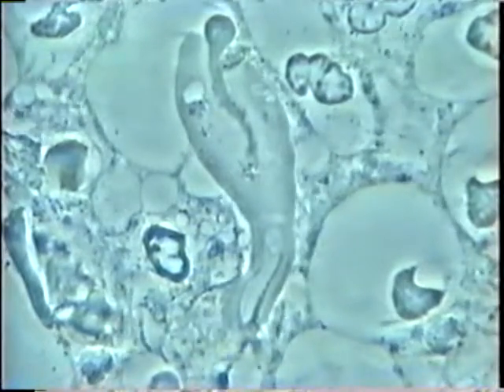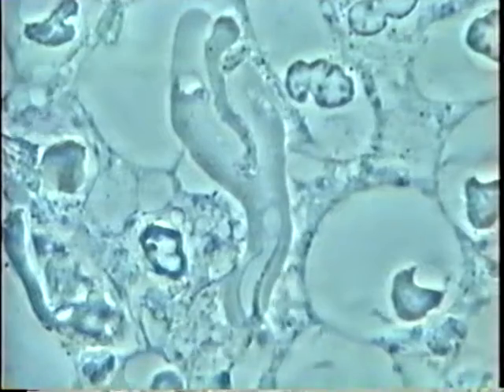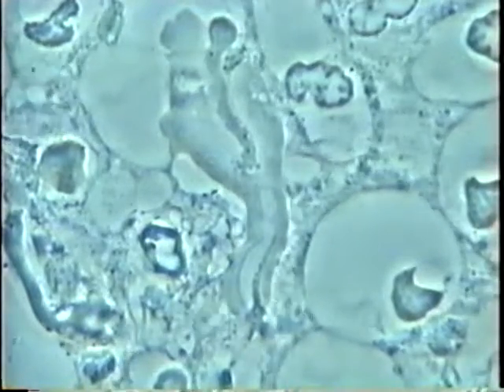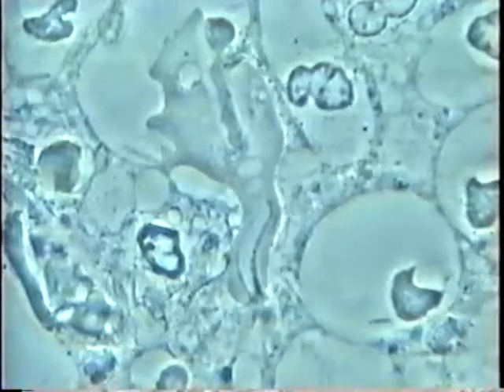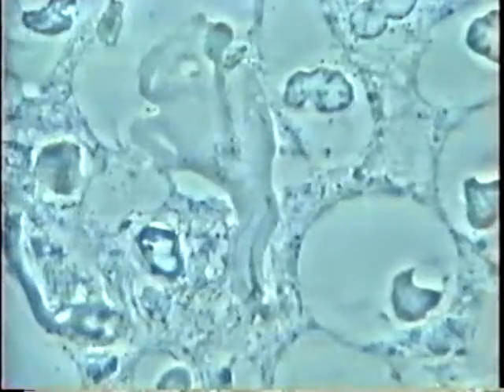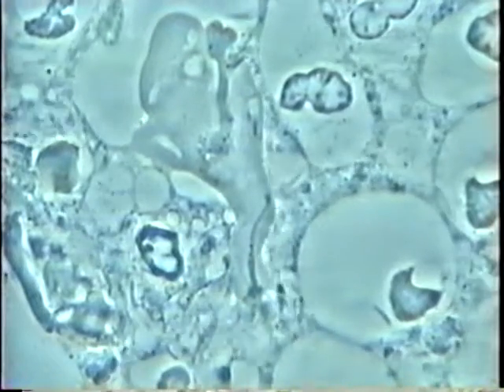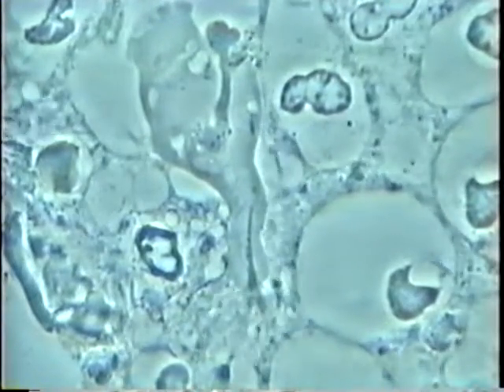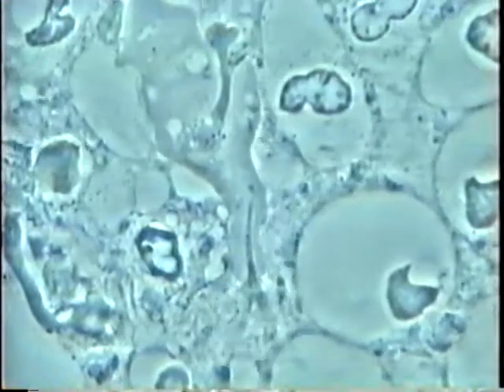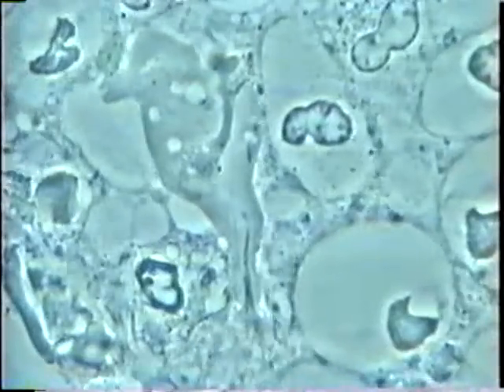With something like amoeba pore, the white cell is not moving anymore, and the parasite literally suctions the inside of the nucleus of the white cell to get its food. You can see it is almost done here — at the top the amoeba is almost finishing feeding, via phagocytosis, from the nucleus of the white cell. This will leave the white cell without a nucleus, which contains many enzymes that will contribute to destroying the tissue in your gum — destroying the fibers and bone around your tooth. This pattern is very typical in gum disease.